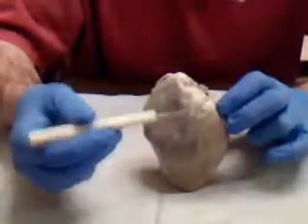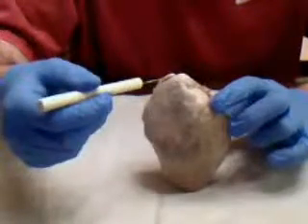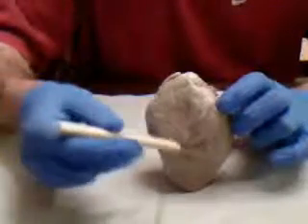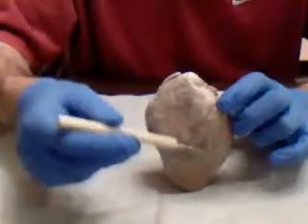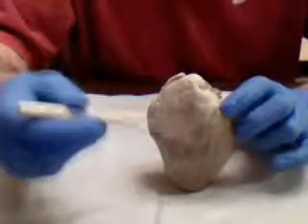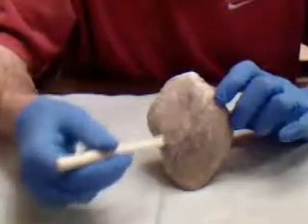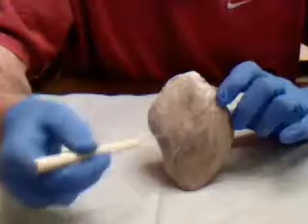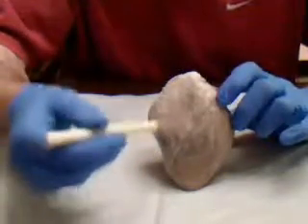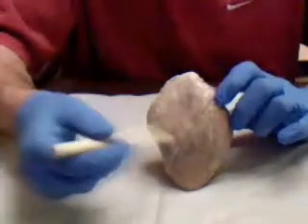And the right and left auricles are able to increase the atrial volume and receive blood returning to the heart from circulation. Right here, this is the right ventricle, and over here we've got the left ventricle. And the right and left ventricles are the discharging chambers of the heart, and they act as pumps. In between the two, separating them, this is called the interventricular sulcus, and it separates the right and left ventricles. The major blood vessel found in the interventricular sulcus here is the anterior interventricular artery, and that mostly supplies the blood to the two ventricles.